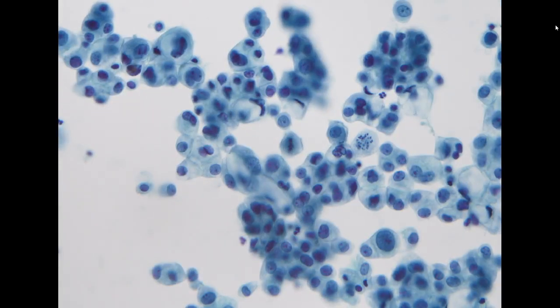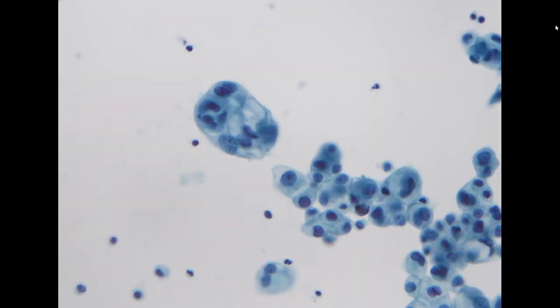So this is a recurrence of the adenocarcinoma. You can compare with the adjacent lymphocyte. This is markedly enlarged, so this is compatible with recurrence of the patient's long history of lung adenocarcinoma. If the patient already had a history, we won't do TTF1. However, if the patient is a new patient, we will do a TTF1 to confirm it is primary from lung.